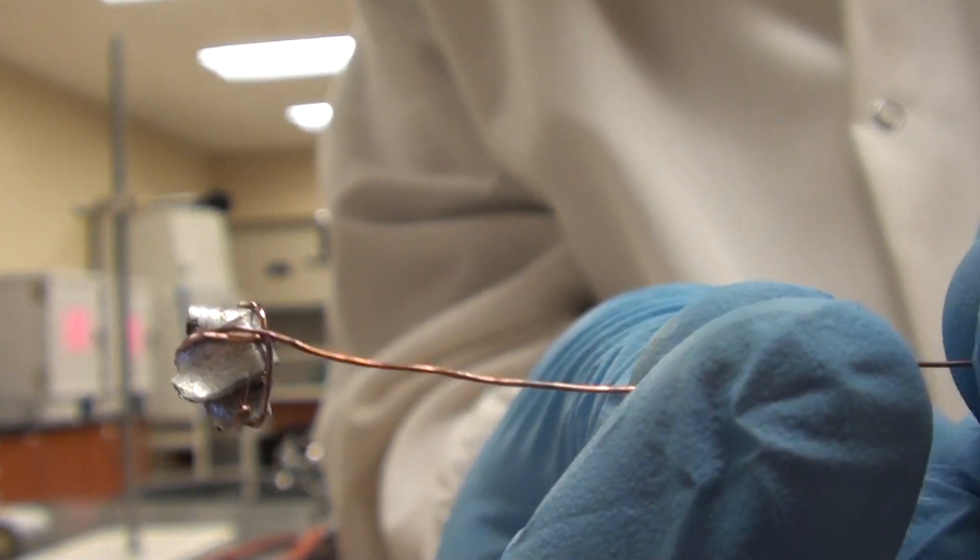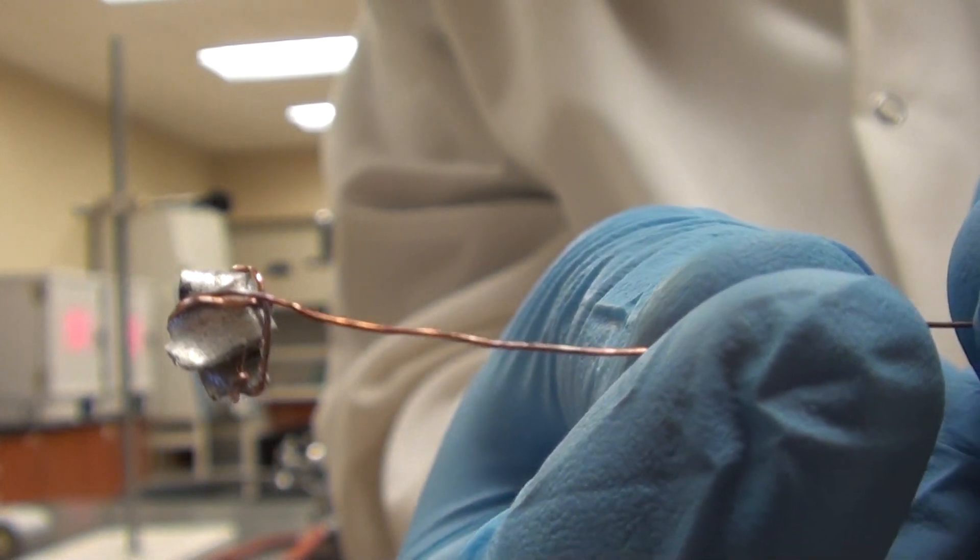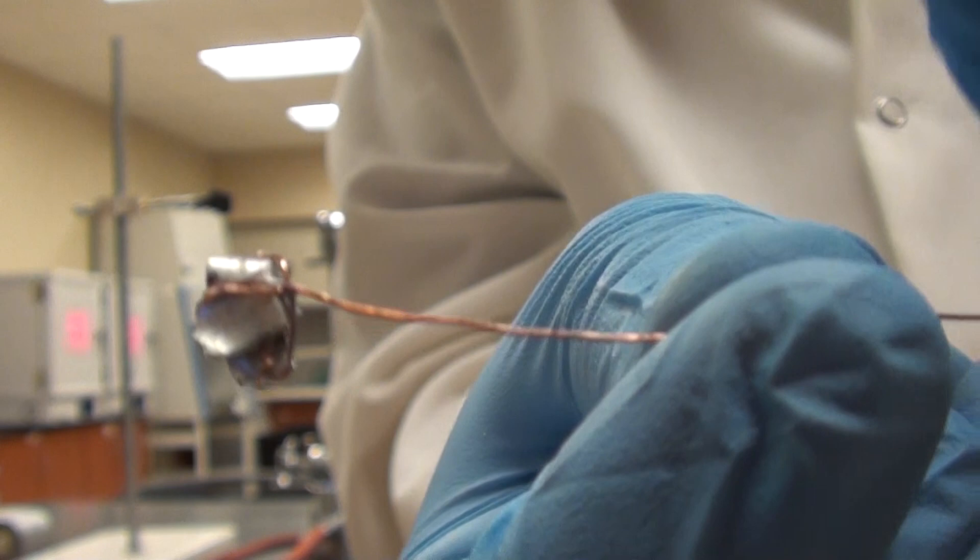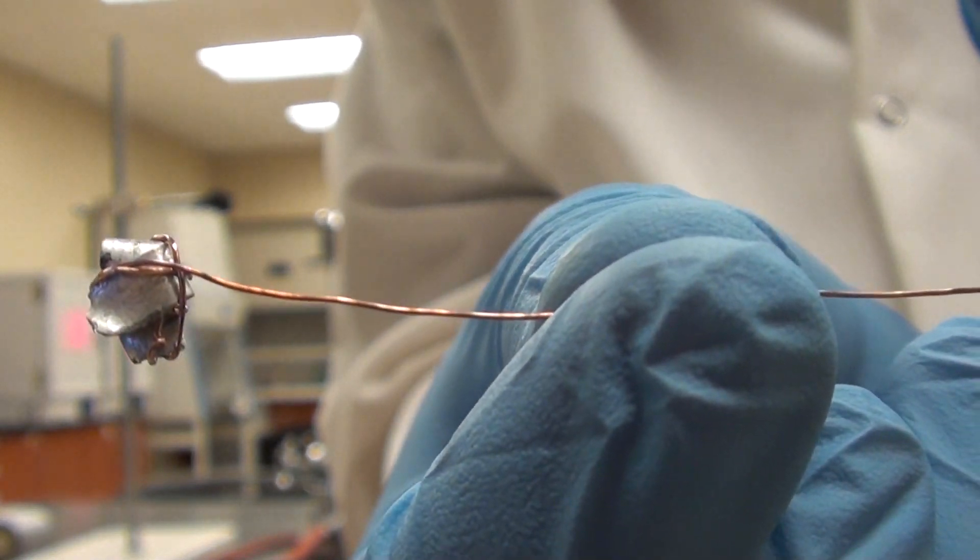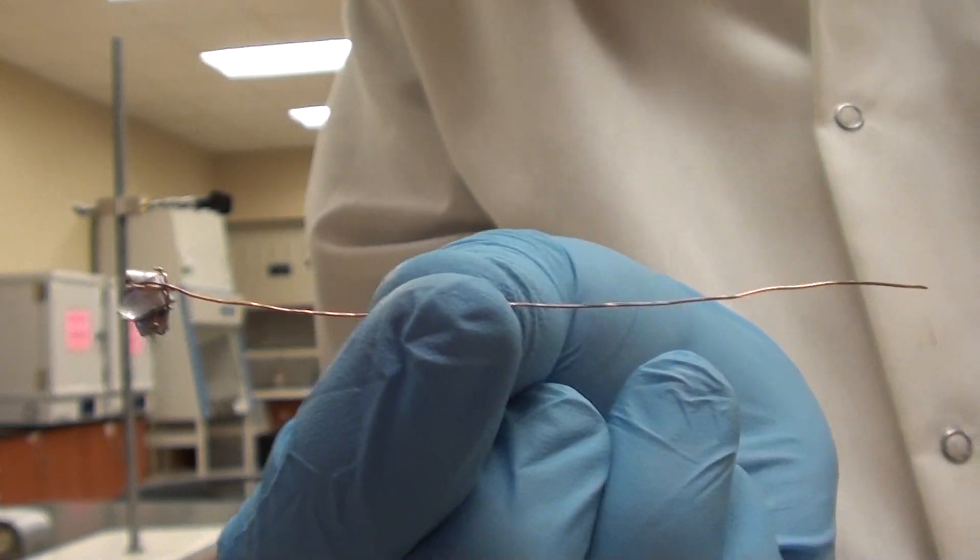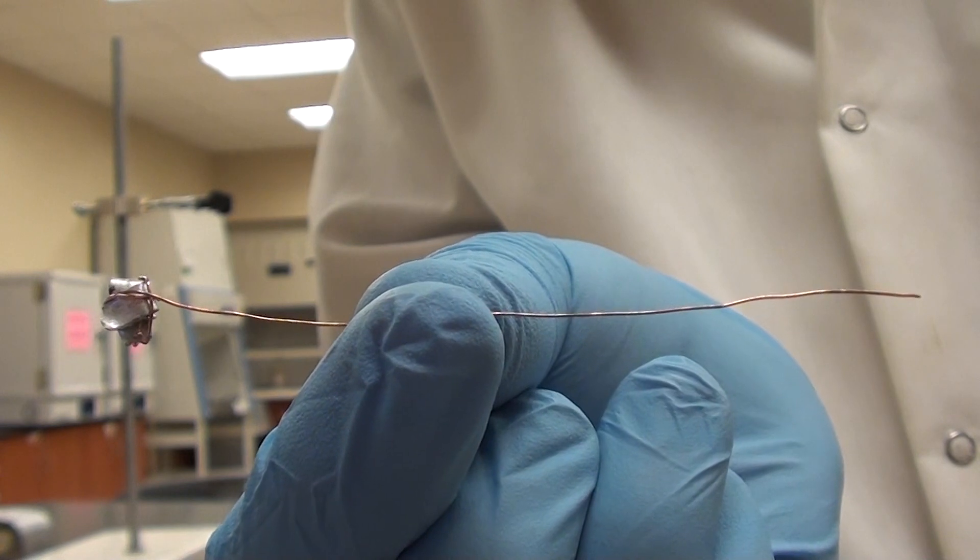Kind of cross it over a bit, kind of like you're wrapping a present. So there you go, that would be the magnesium. And that's going to be in a copper cage, and it's ready to put into the eudiometer tube. Notice again, there's a fair amount of copper left at the end. That can go at the bottom of the tube.